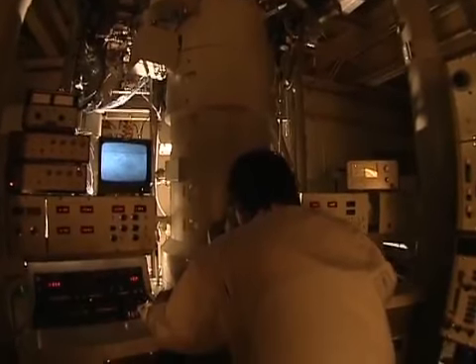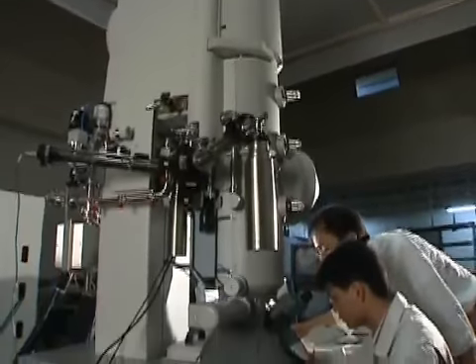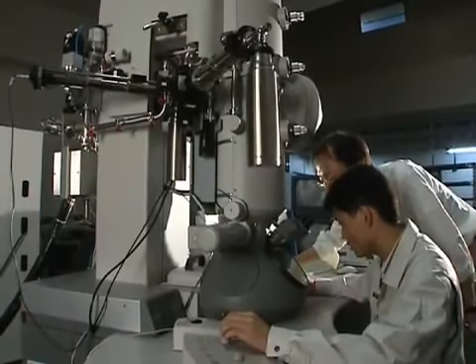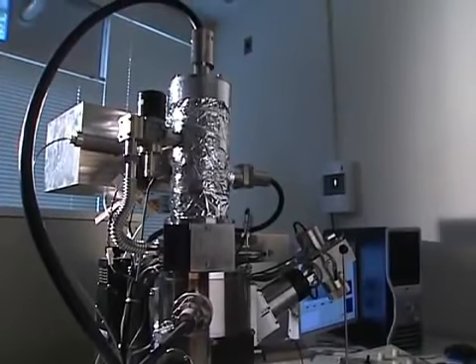In addition to these microscopes, Nagoya University has many others with high performance. If you are unsure of which suitable microscope to use for your project, the coordinator, who is an expert in electron microscopy and material science, will be there to give advice.